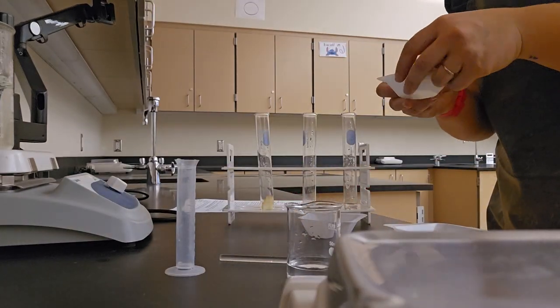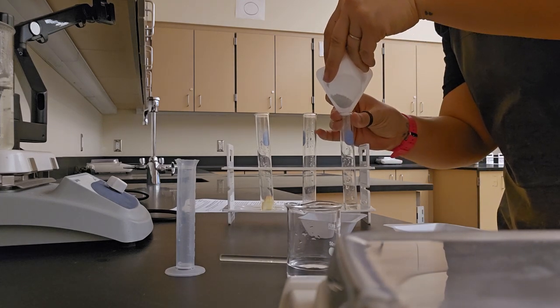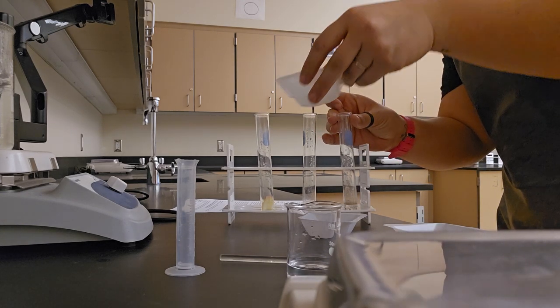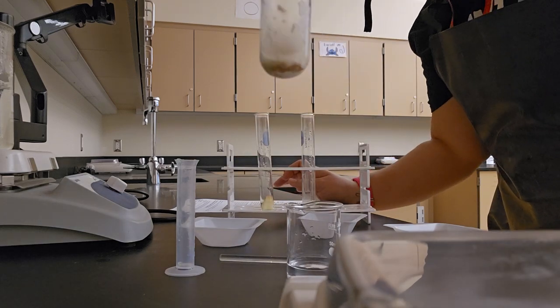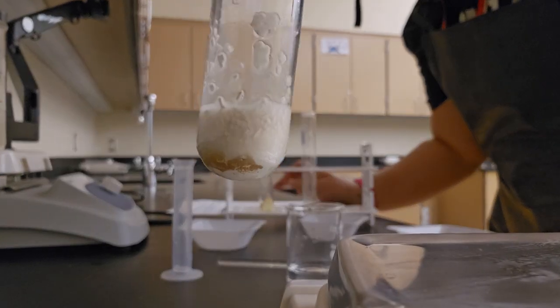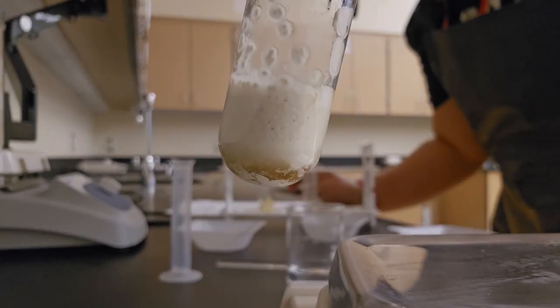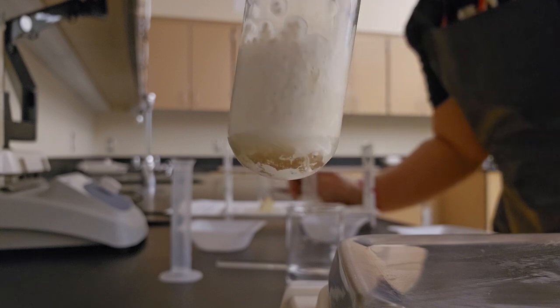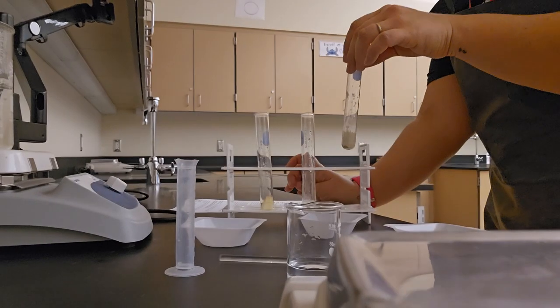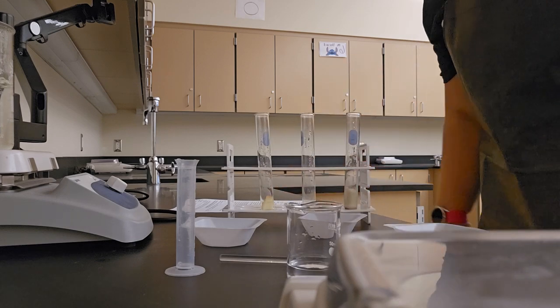And finally, my yeast sample. And again, a reaction. Better than my potato, but not as good as the liver. Record those 3 and then clean up part B.